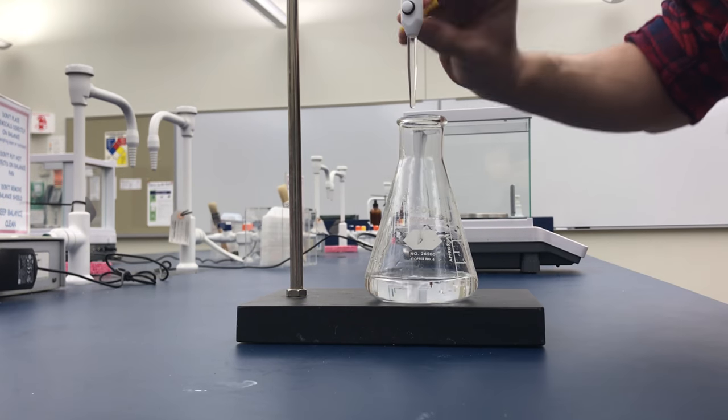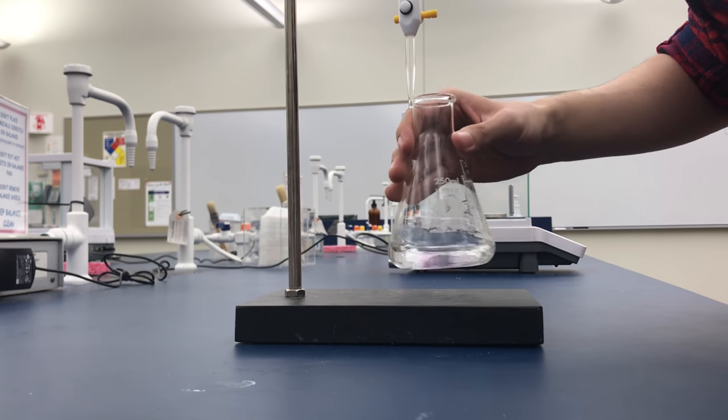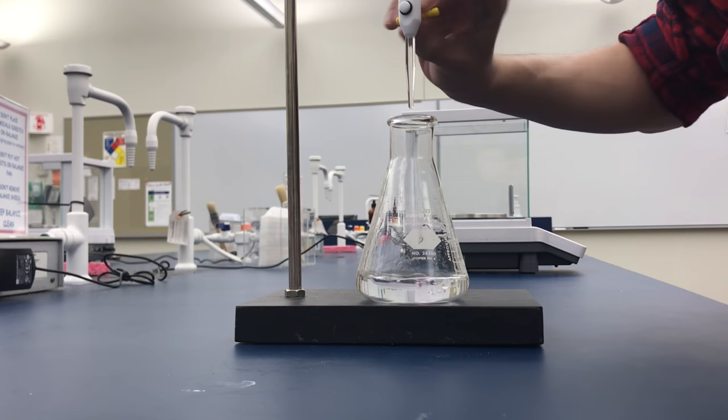Titration should be conducted until the product remains a light tint. Record the final volume of the known solution.